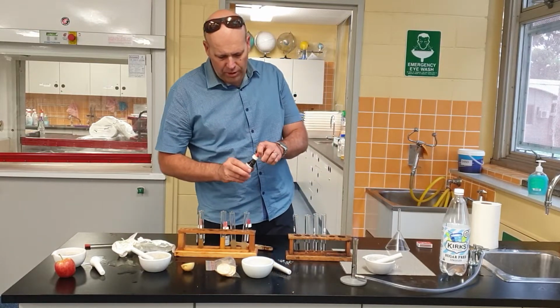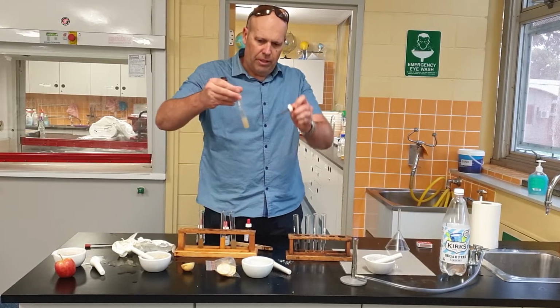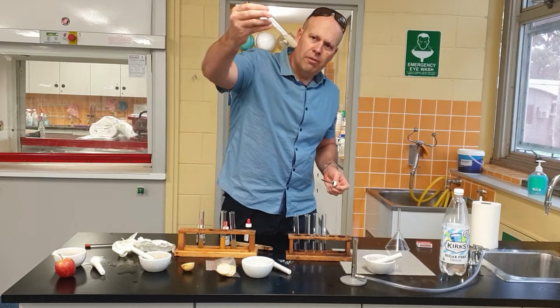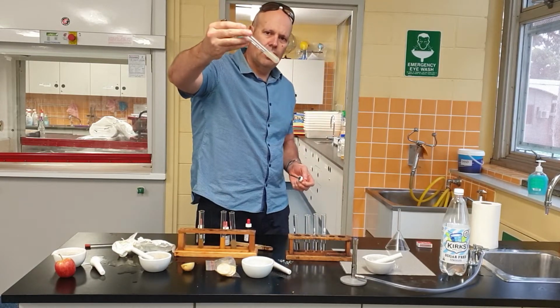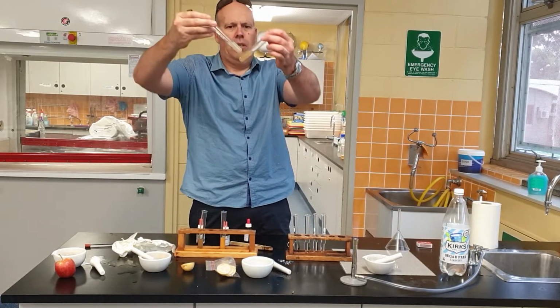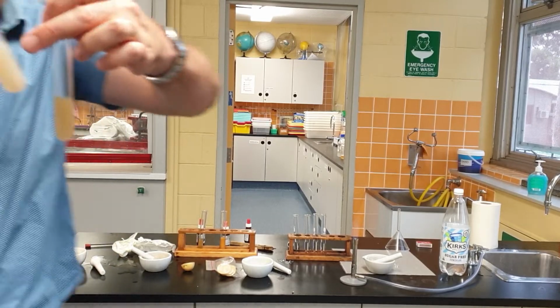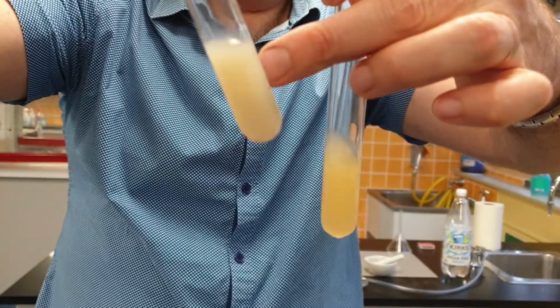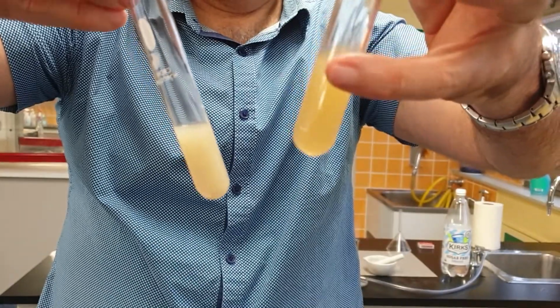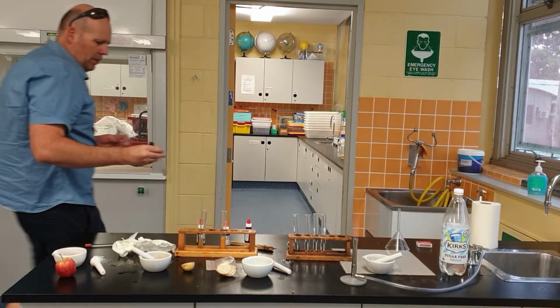All right, so what about some silver nitrate? What about testing for salts? Let's put it in and see what we've got. What do we got here? Oh, what do you reckon? I reckon there's salts in there, absolutely. You bet there is. Has it changed? I think it's gone whiter. So remember, it's a cloudy white colour for salts, whereas there's been nothing happening there. So I reckon yes, the salts.